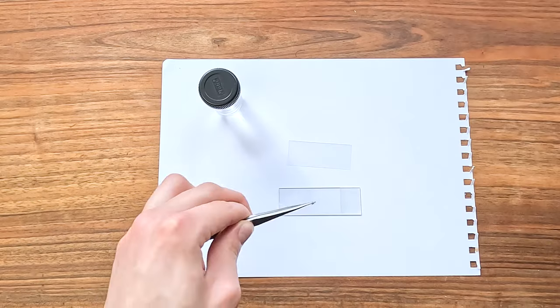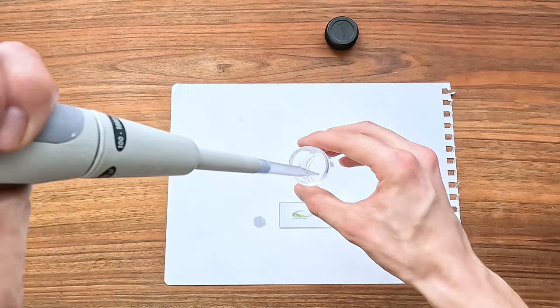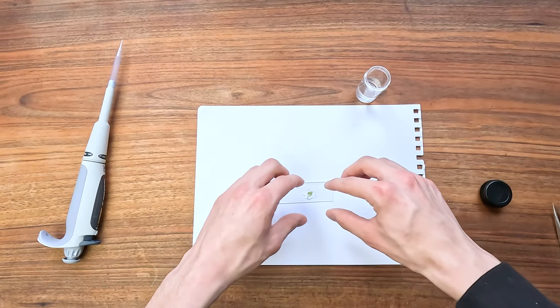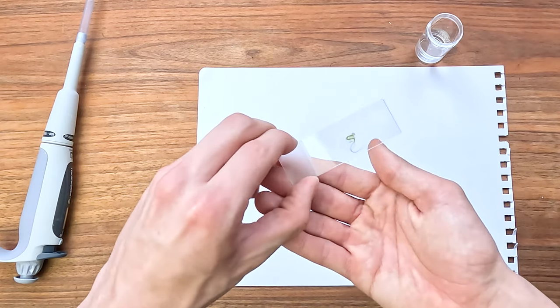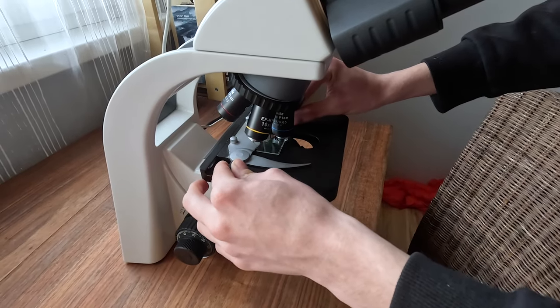Sample collection done, and now comes sample processing. I'm only going to show you how I did it for the algae, because it's a bit too repetitive otherwise. First I put the algae on the glass slide, then I added a bit of water to hold the cover glass, and lastly I put the cover glass onto the slide. Now we're ready to put our samples under the microscope, and with the magic of CMOS camera sensors I can show you everything I can see.